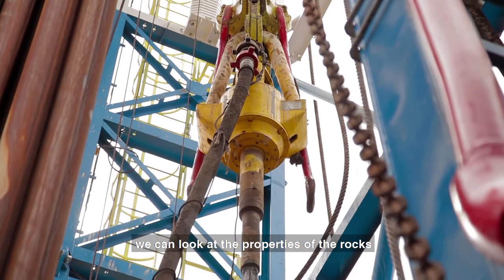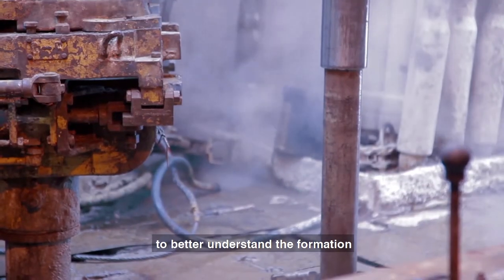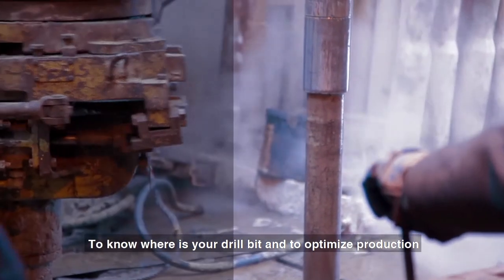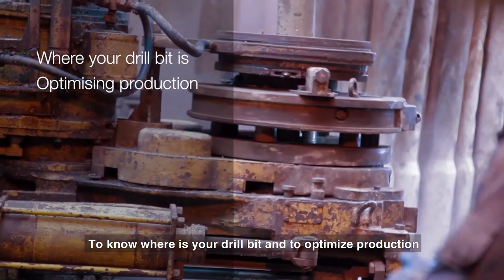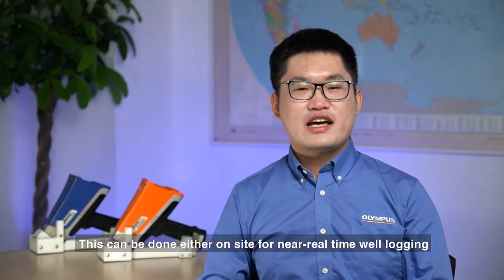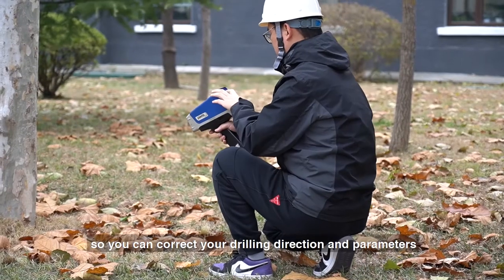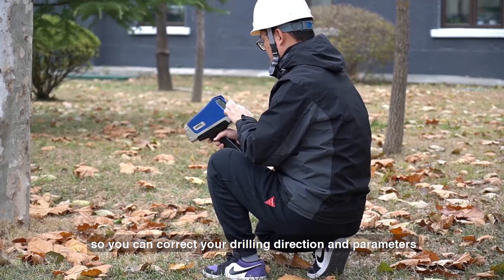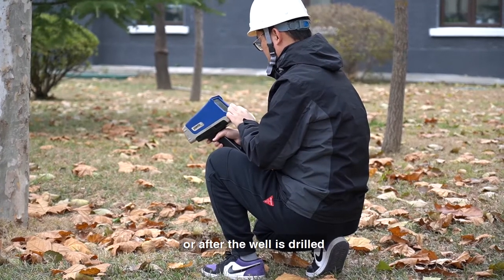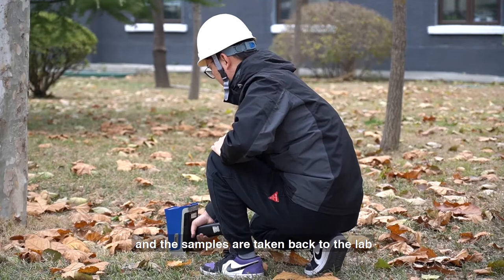When those rocks come back to the surface, we can look at the properties of the rocks to better understand the formation, to know where your drill bit is, and to optimize production. This can be done either on-site for near real-time well logging, so you can correct your drilling direction and parameters, or after the well is drilled and the samples are taken back to the lab.